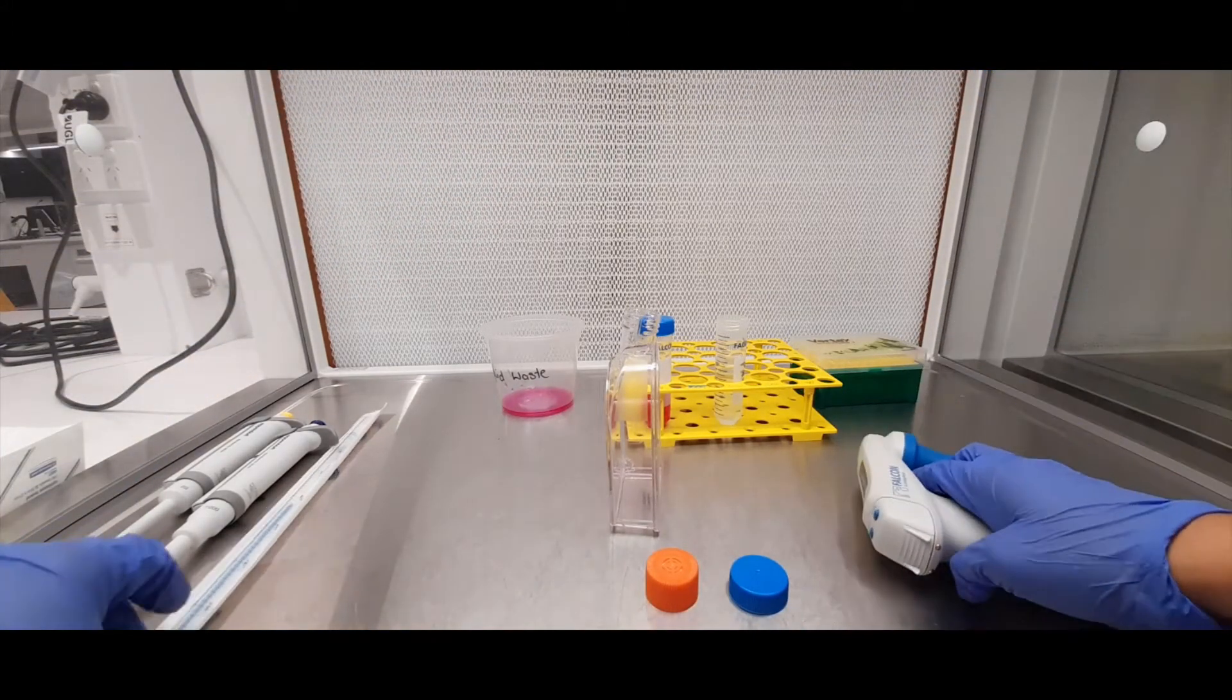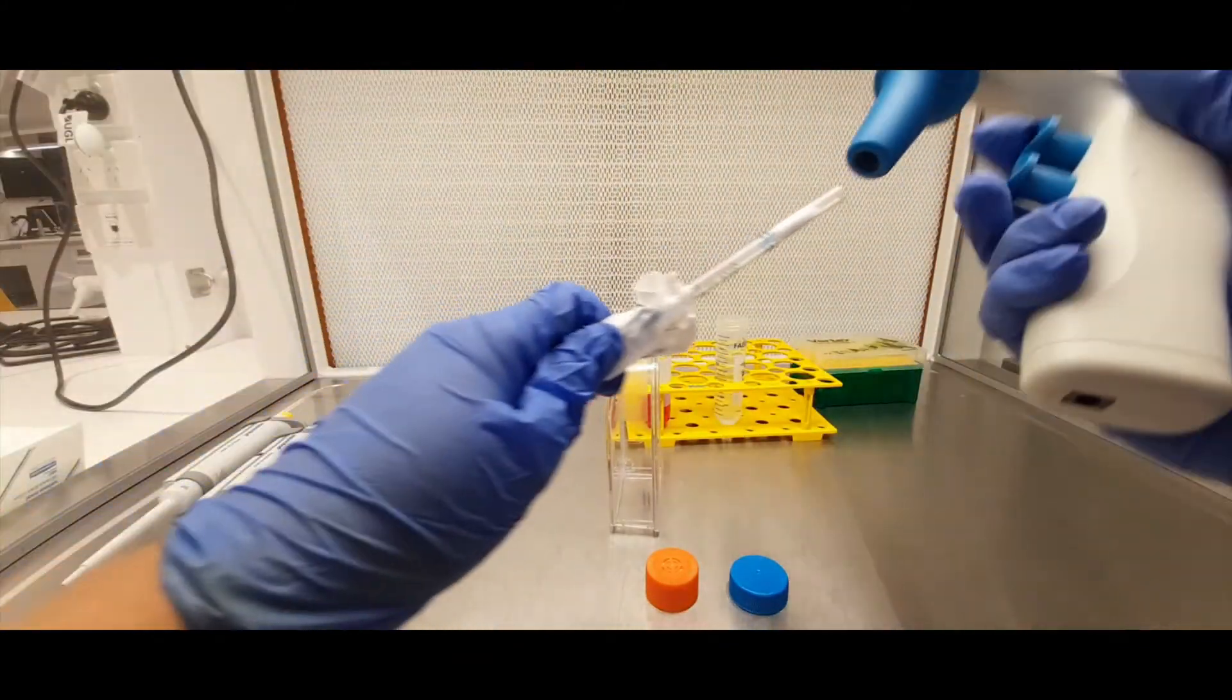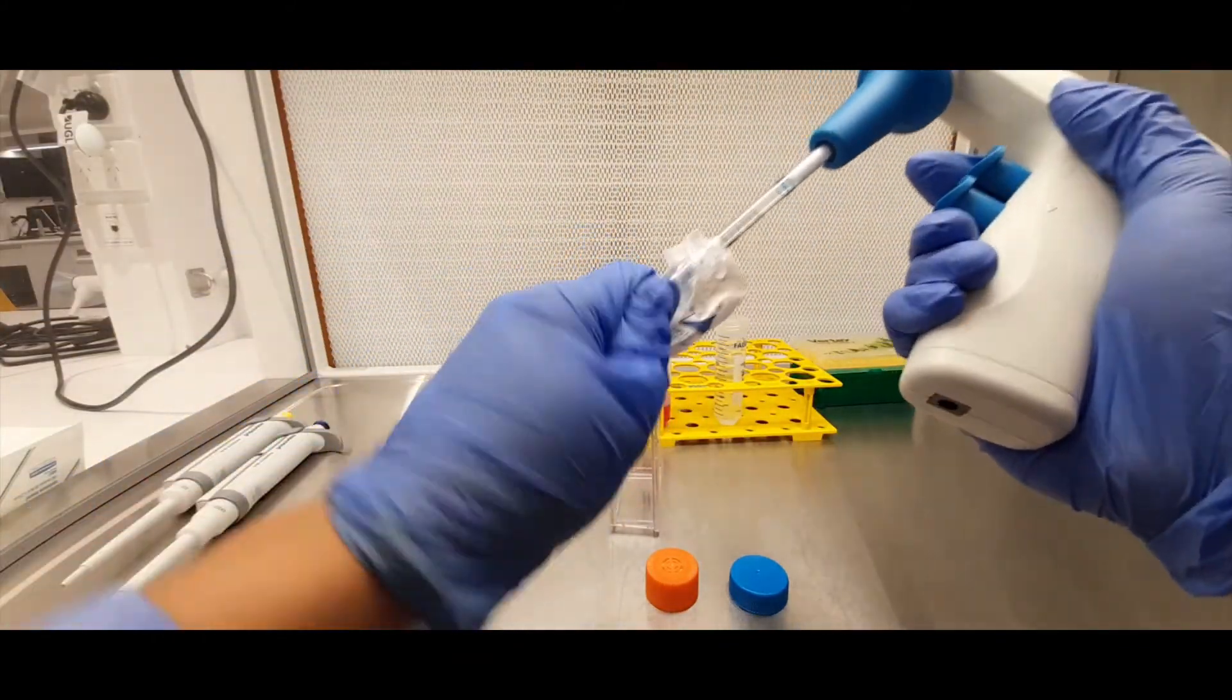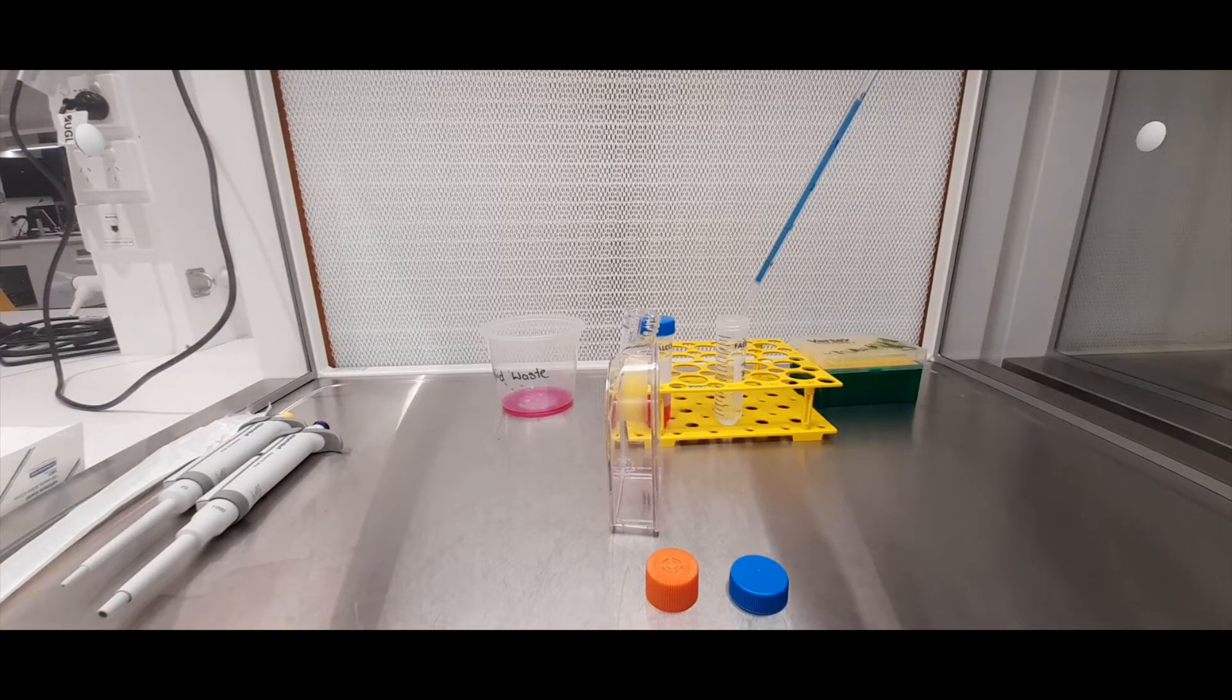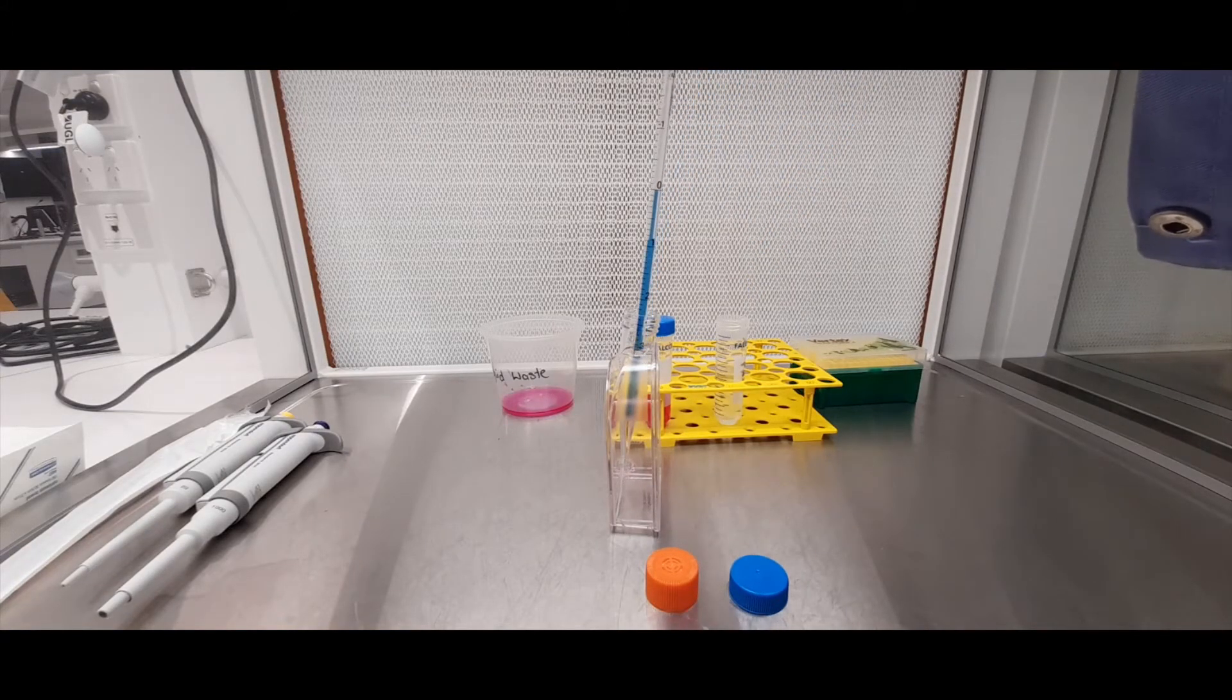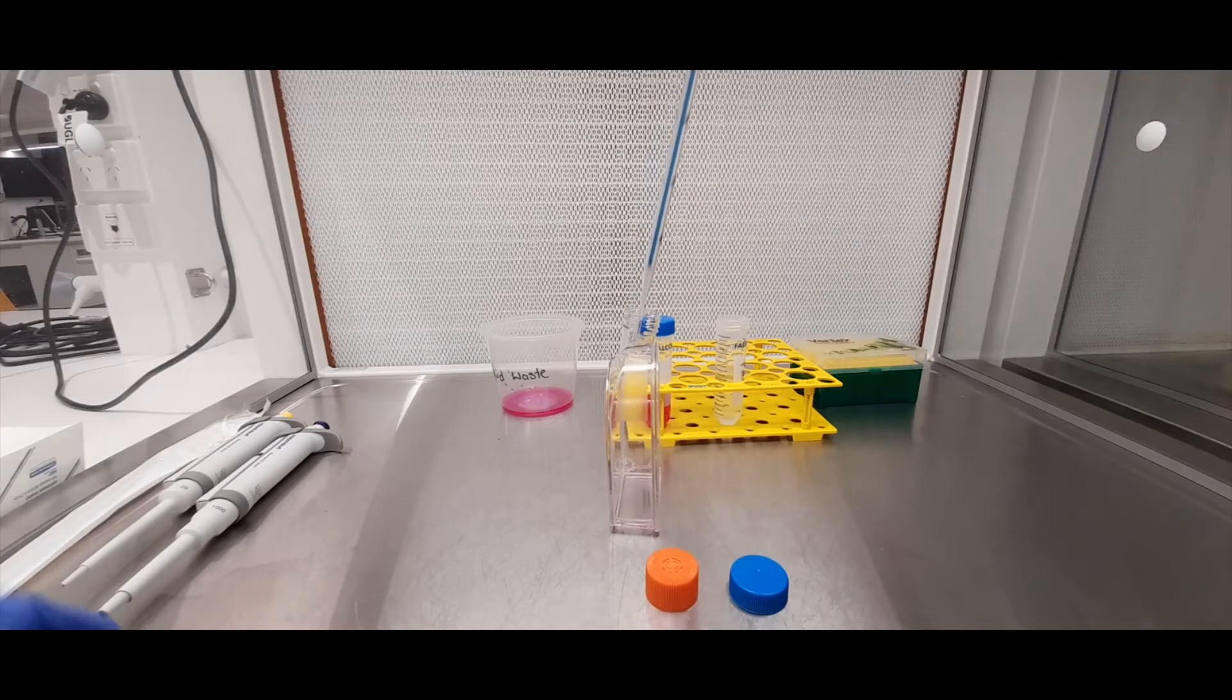And then let's say we want to transfer some saline solution into that flask to wash the cells. So we take, say, let's say five mils of saline solution, put it into the flask, and then we dispense.